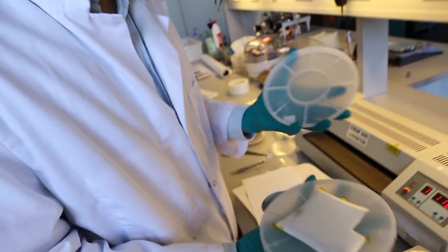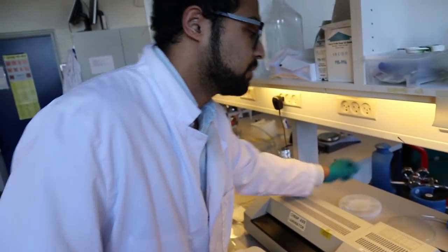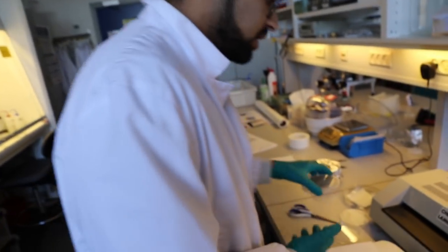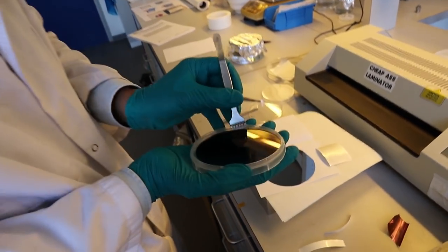So we could also make graphene foil and just send to people. Exactly. We actually store these for several months and then use them as we want. We cut off how much graphene we want on this PVA foil. Now we're going to transfer this onto our silicon dioxide wafer.